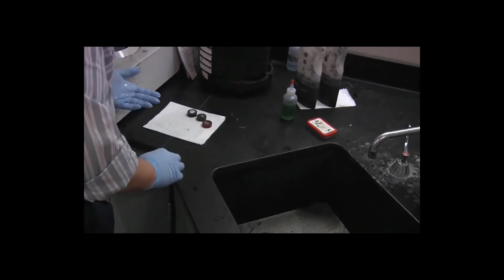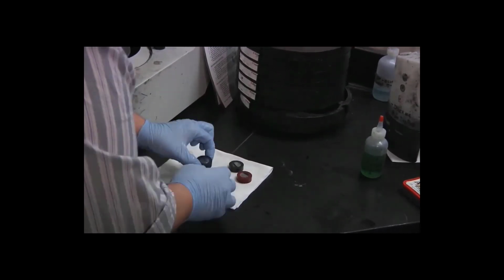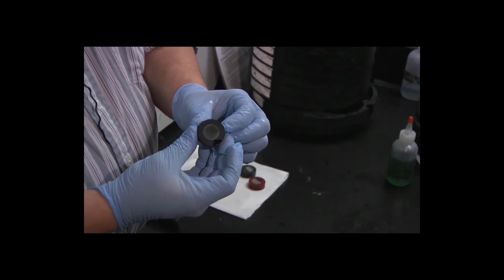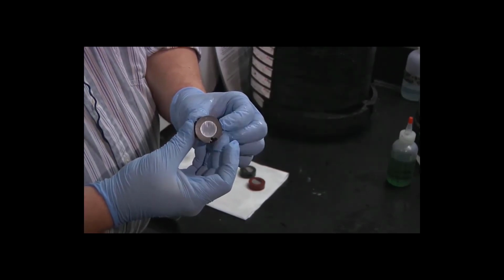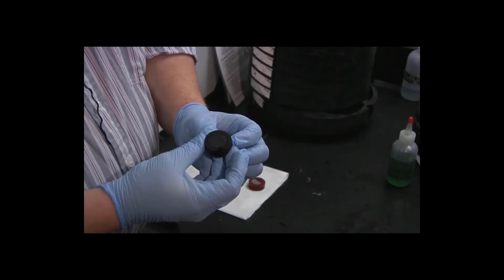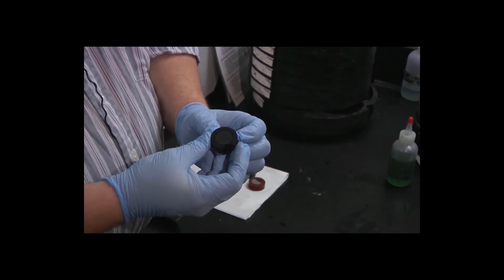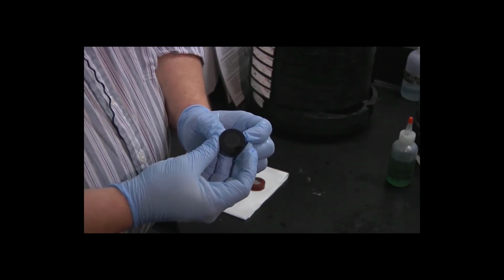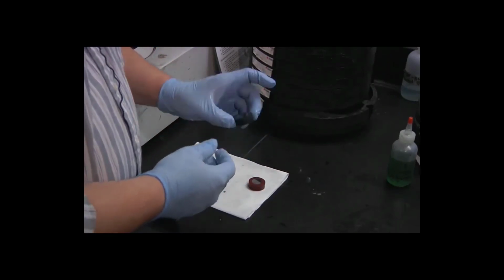Okay, so now we can inspect our specimens, again being very careful not to touch the metal surface. And we basically have a mirror. There's a few scratches in the surface that I can see. They're not too bad. And given that the area that we need to work with for these under the microscope is probably about a millimeter square, maybe 2 millimeters square, there's plenty of room on here where we have a really good surface. We can work around the handful of scratches that are still visible.